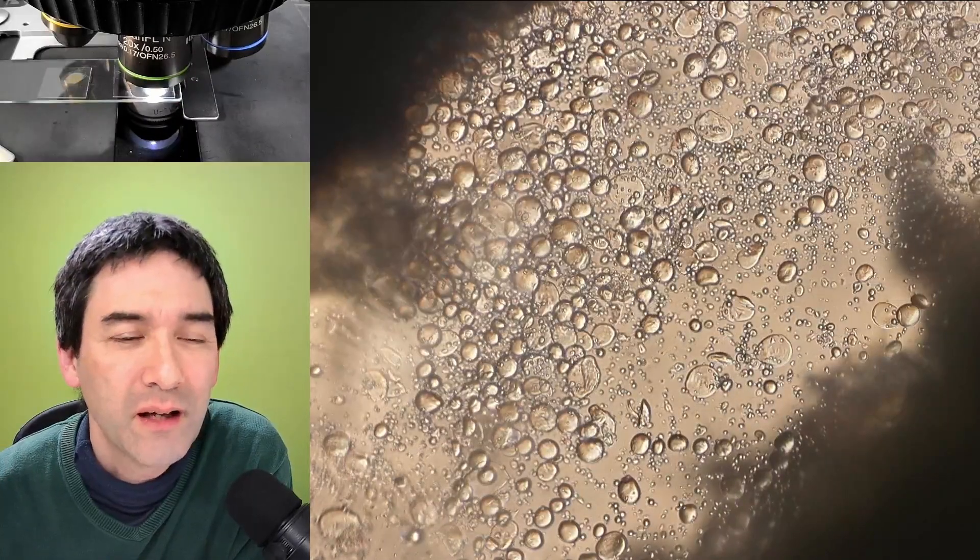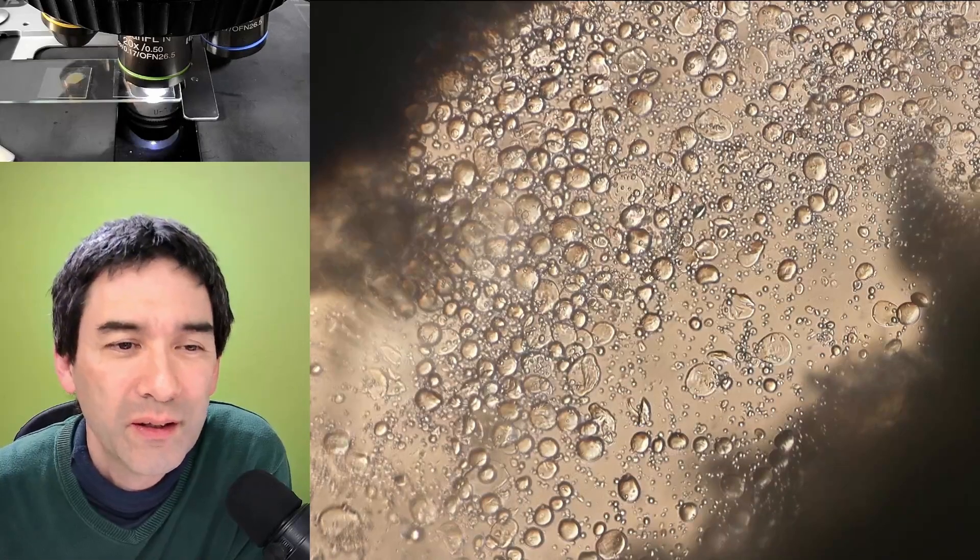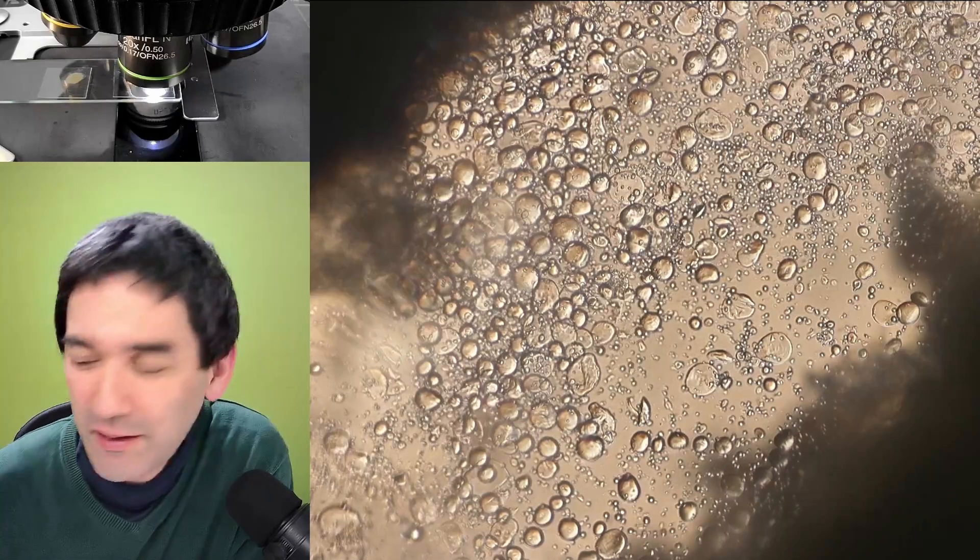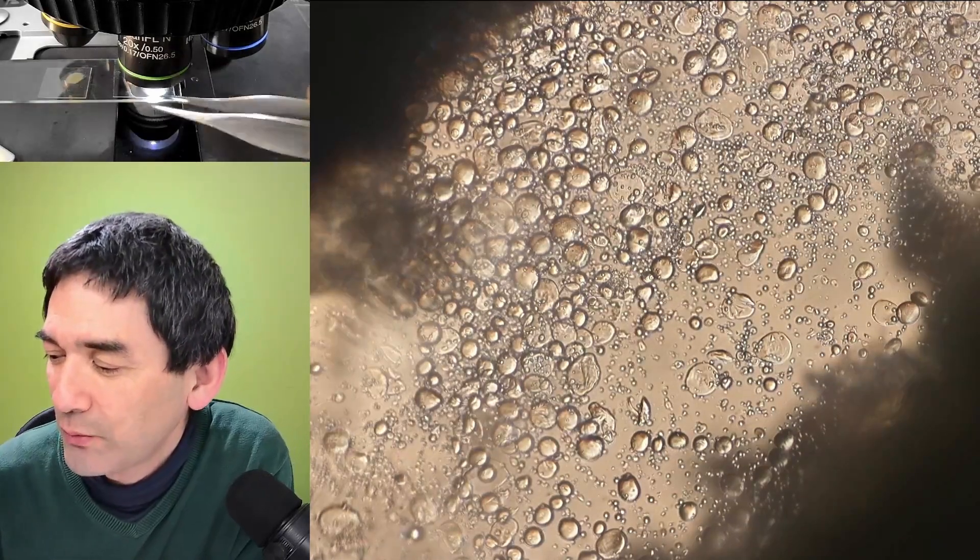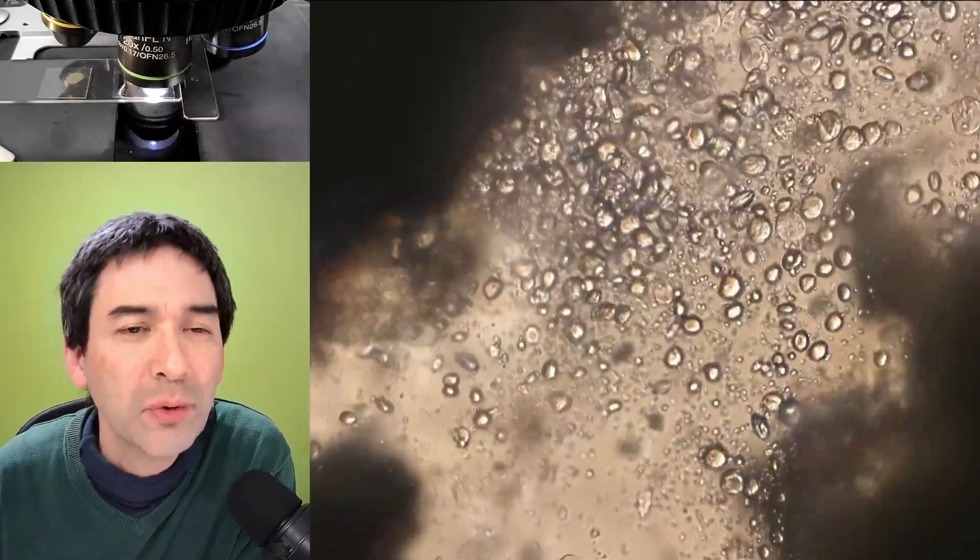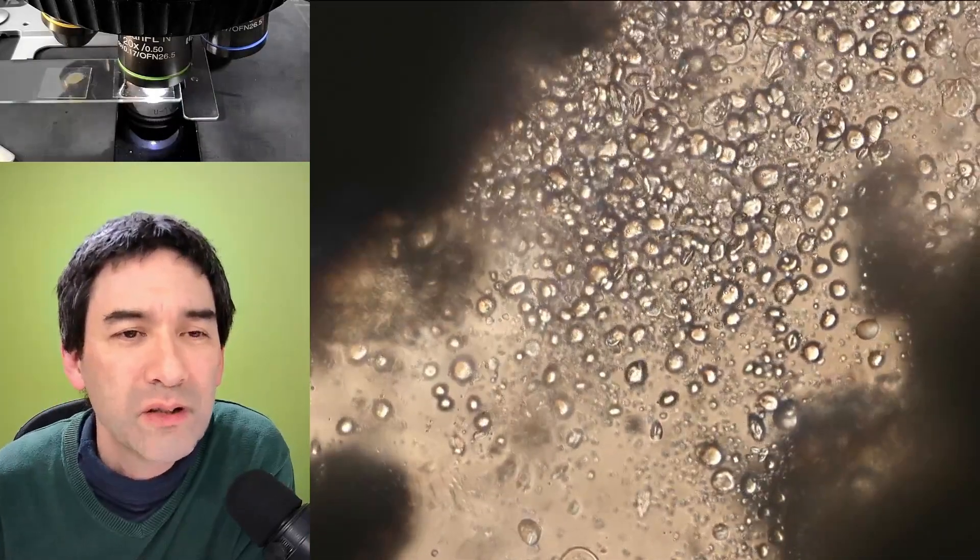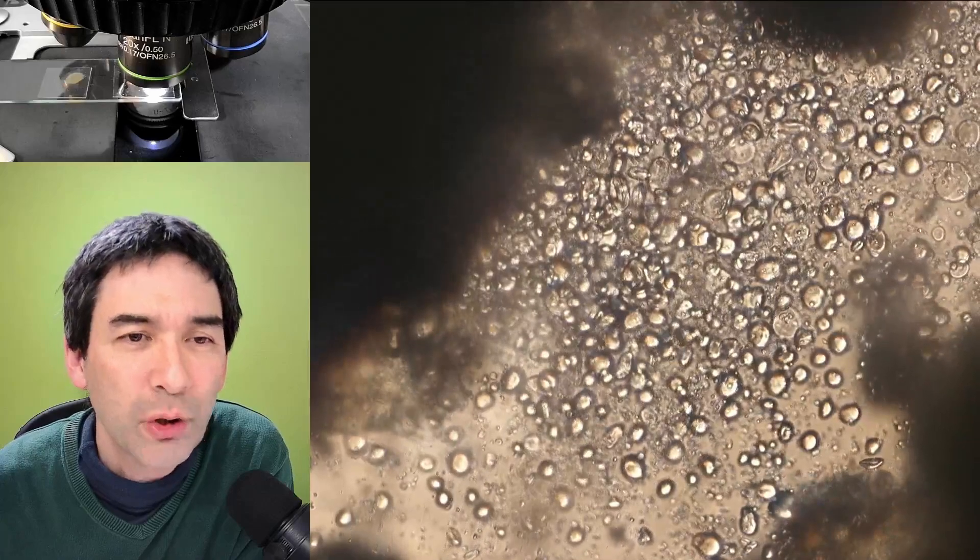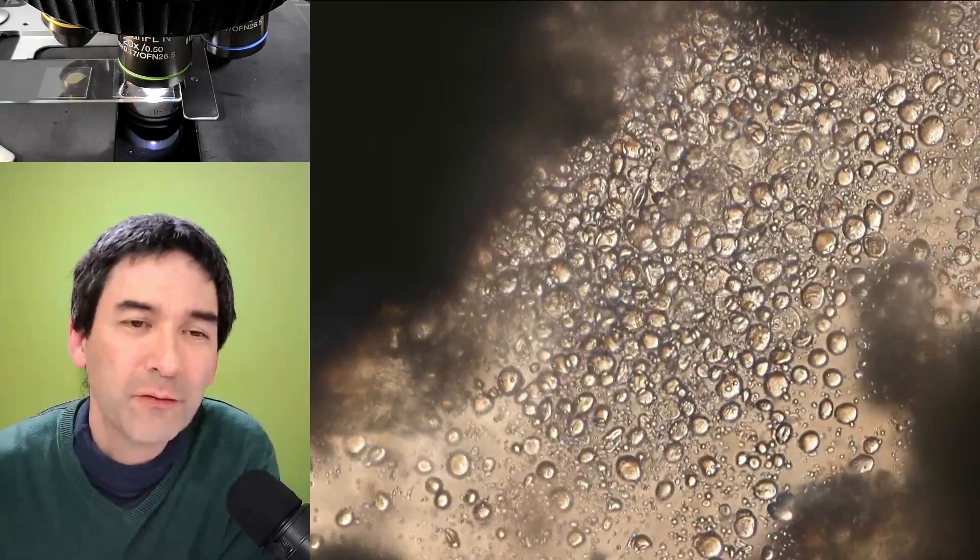You can see that as the water is spreading, some of the liquid is still flowing a little bit. If I touch this, let's see if I'm able to mix this a little bit more. And look, this looks very much like starch grains that are now released from the cookie.